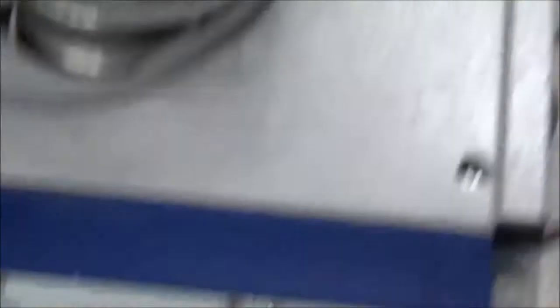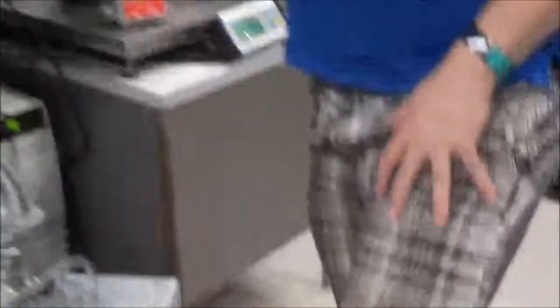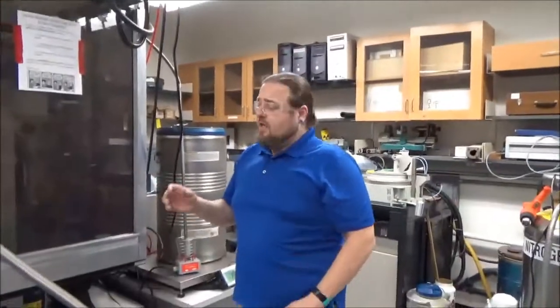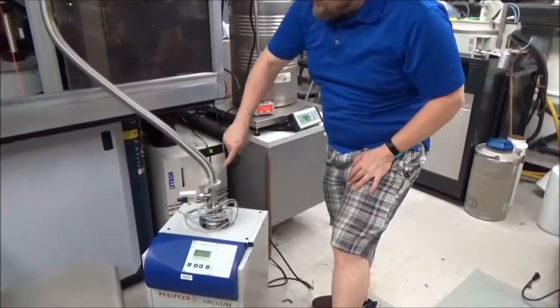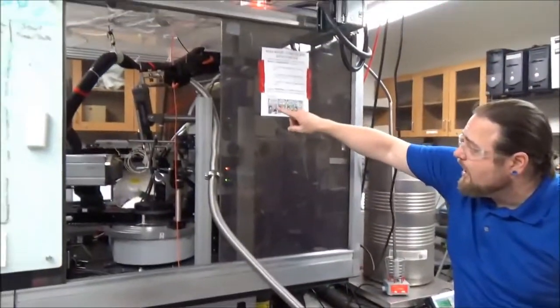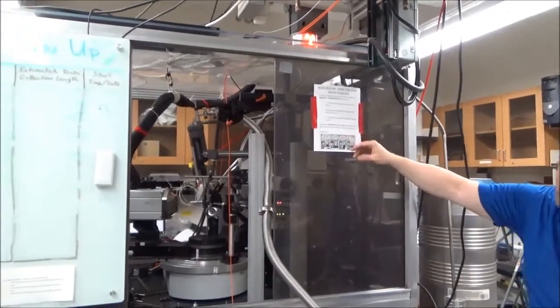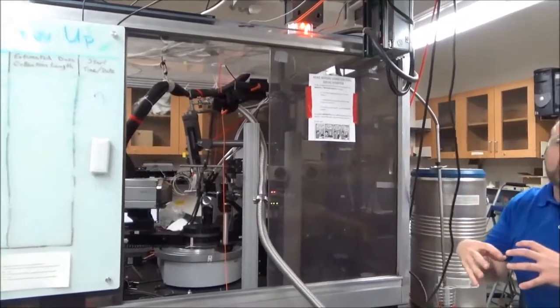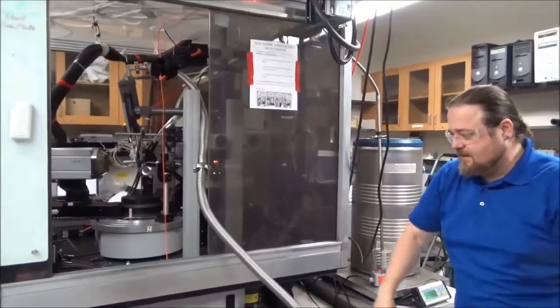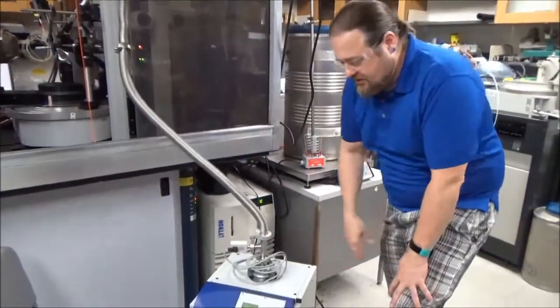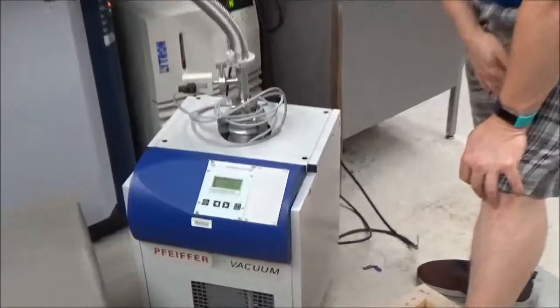Now, it's important to note that the only thing we're pumping down here is up to the connector, right? The system is still closed. So we're just basically pumping down this tube. And so this, we should be able to reach a low pressure pretty quickly.